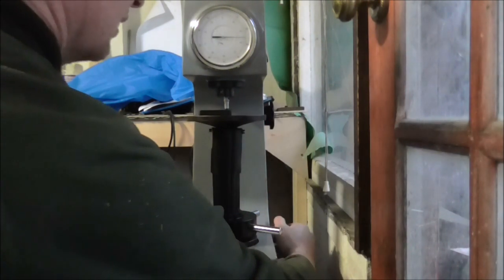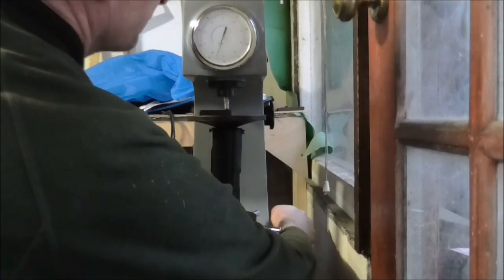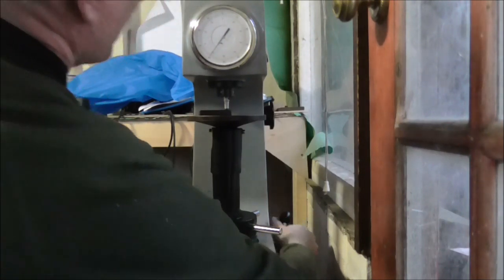So I'm going to push the unload button and the final reading. I'm going to give me the Rockwell reading.